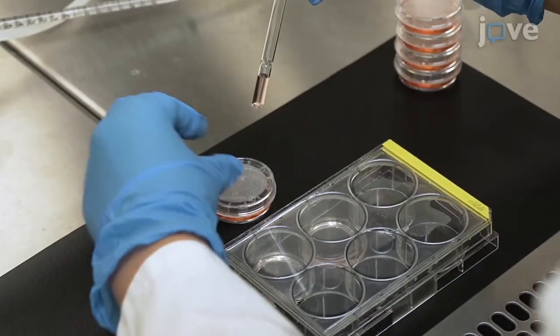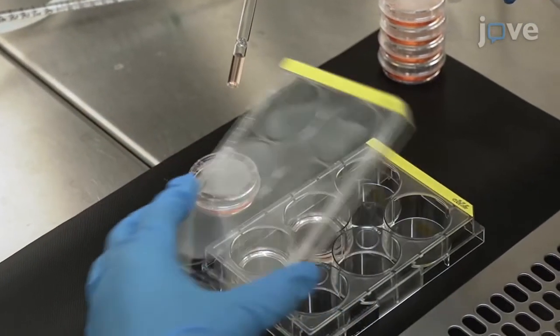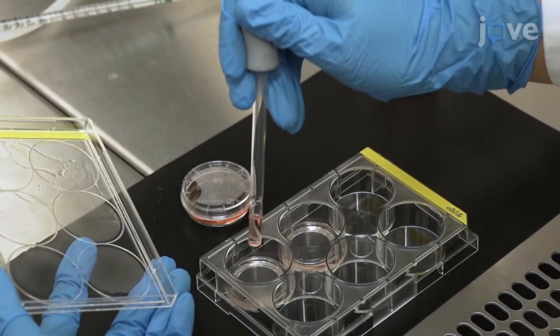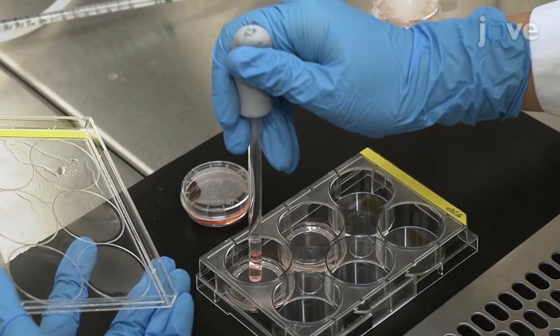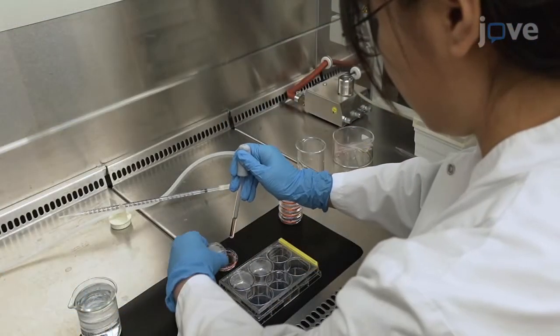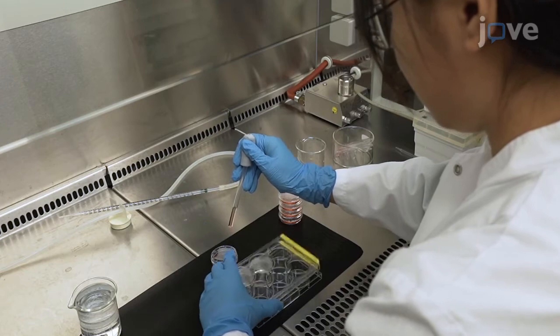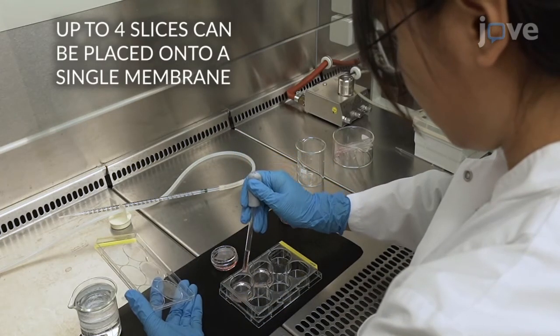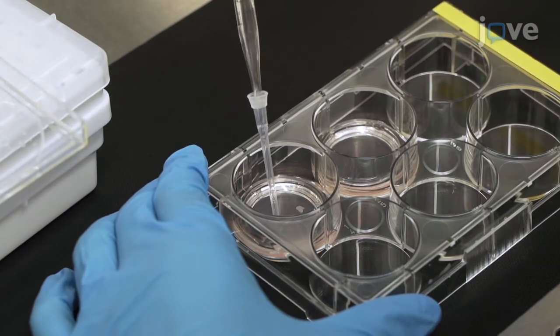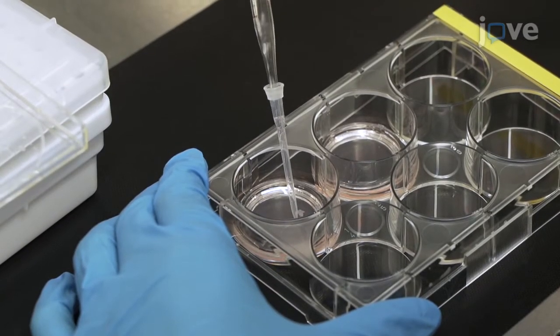Using a pipette, gently place one slice at a time on the top of the culture insert. Avoid turbulences in the pipette and wait until the slice descends to the tip of the Pasteur pipette. Repeat the process for each slice. Place 2 slices on a membrane. Carefully remove any excess Hanks solution from the top of the insert by using a fine tip.